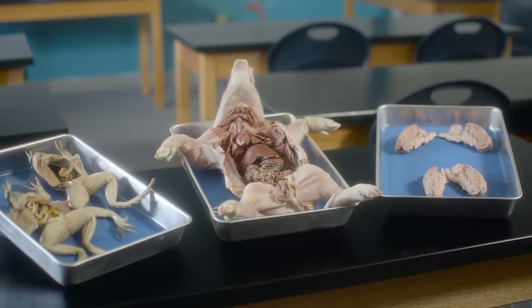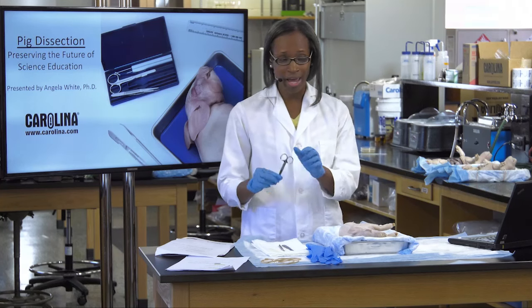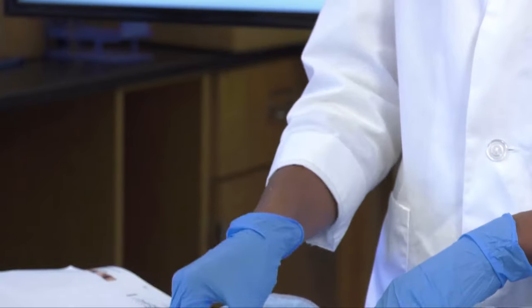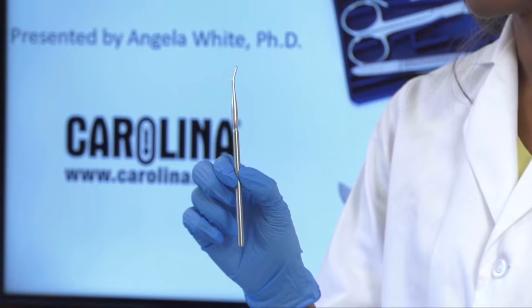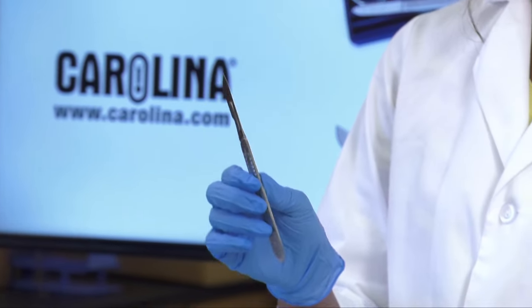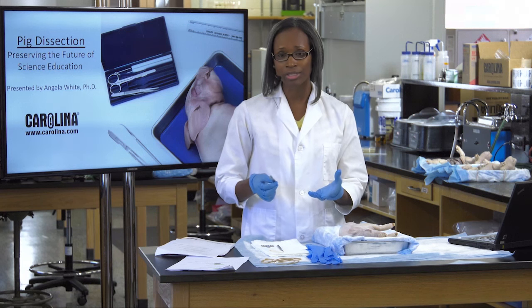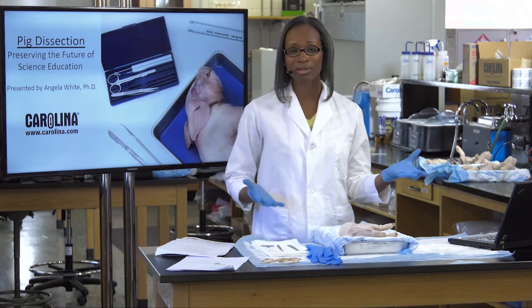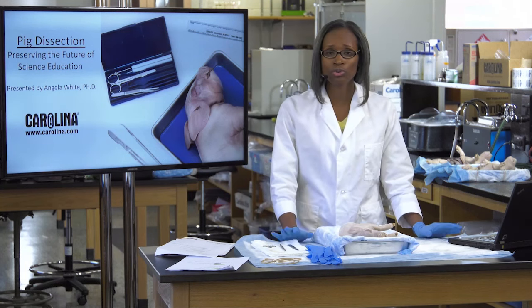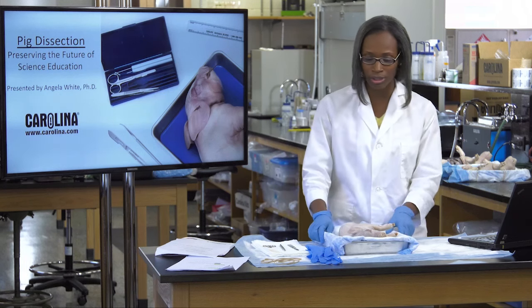You'll need a couple of dissecting tools: a pair of scissors, a blunt probe, and a scalpel. If you have one of Carolina's kits and it's brand new, be very careful because the scalpel is going to be very sharp. I would encourage you to share the same caution with your students — they'll already be excited, so make sure they are very safe as they're using these tools.